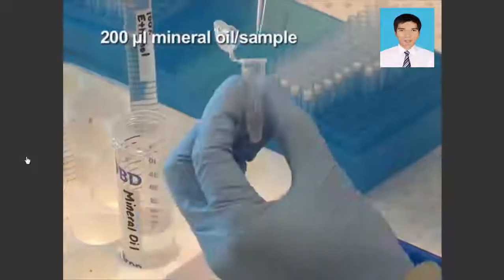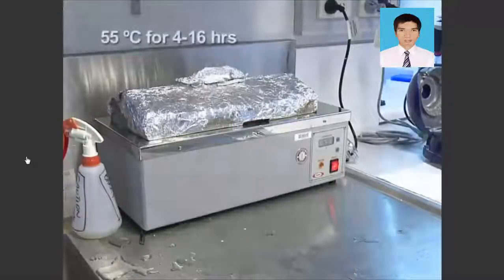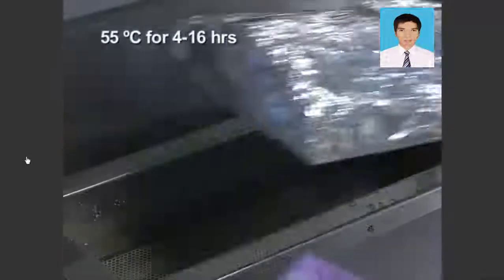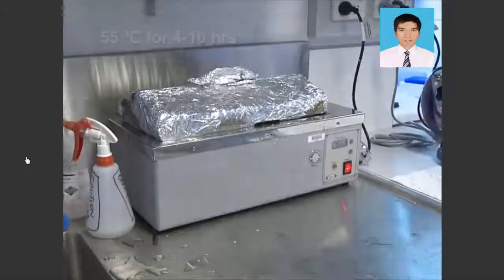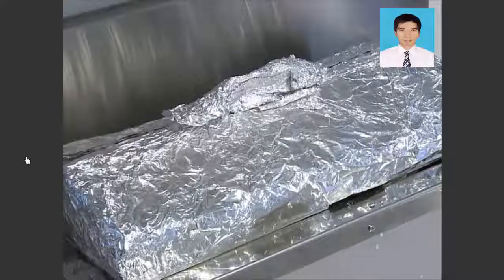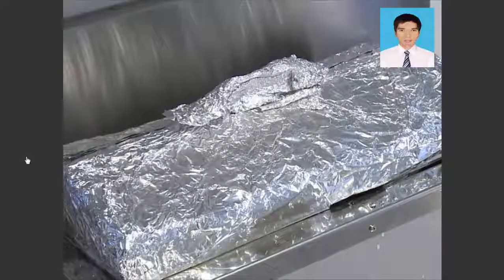Overlay the samples with mineral oil. Incubate the samples at 55 degrees Celsius in a water bath for 4 to 16 hours depending on the quantity and quality of the DNA to be converted. It is important that the bisulfite conversion takes place in the dark to avoid oxidation.